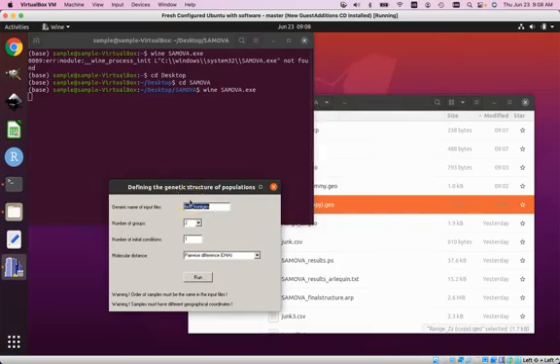Let me try that again by actually typing it in correctly. Underscore. It says no vertex found for a bisector. So that's a big clue. Keep that in mind.